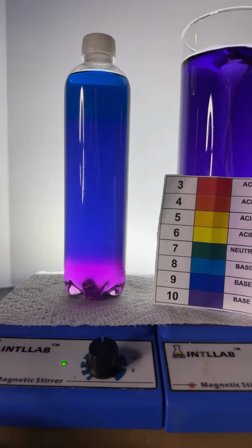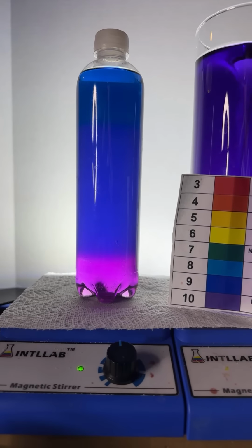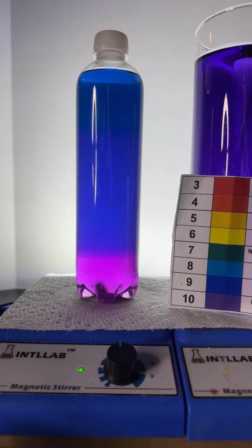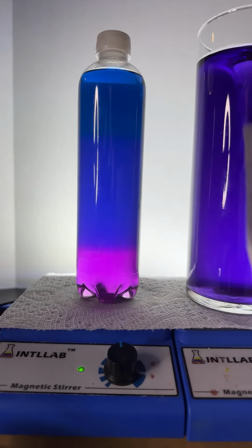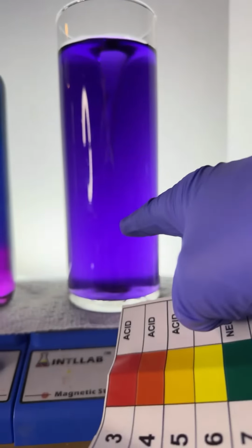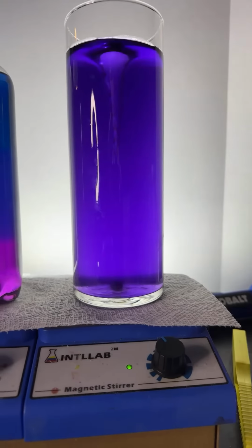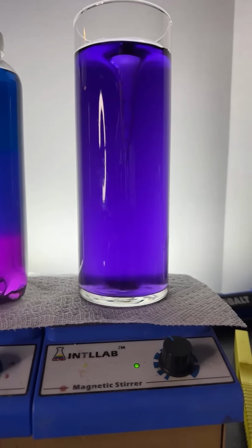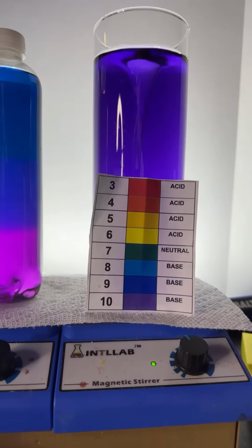The acid and base I'm using are 20% by weight sodium hydroxide and 20% by weight hydrochloric acid. What's happening here is you need to understand that universal indicator actually consists of multiple dyes. I know, it looks crazy, but you're going to get this, okay? It actually contains 4 dyes.